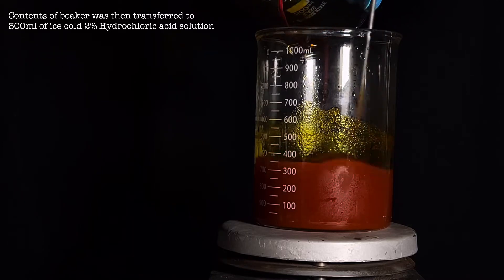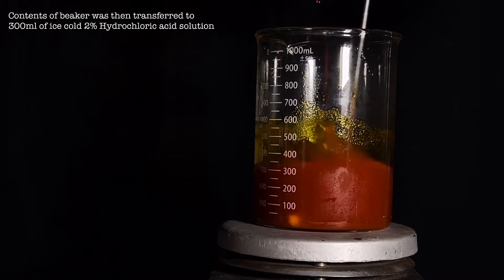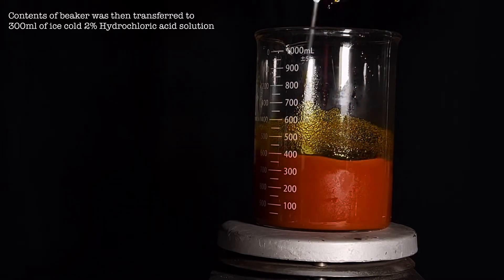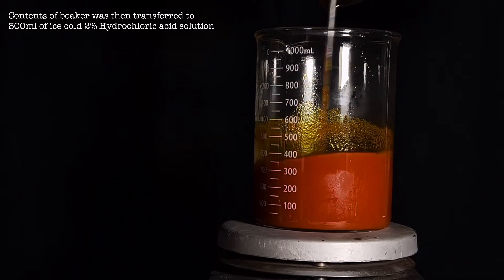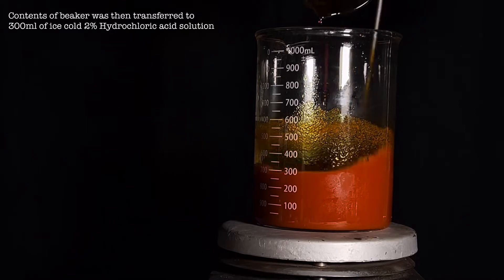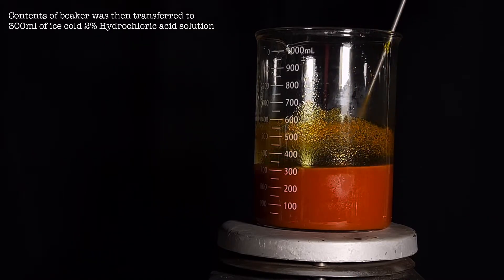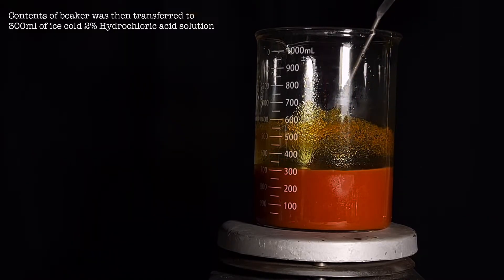If you did not get a precipitate, try vigorous stirring of the contents. Still, if the precipitate does not come out, cool it in a fridge for a few hours.